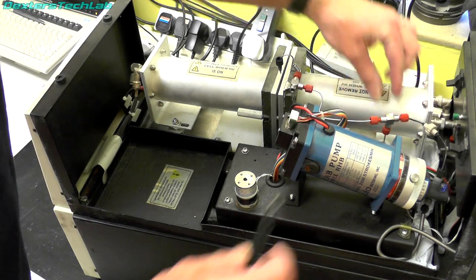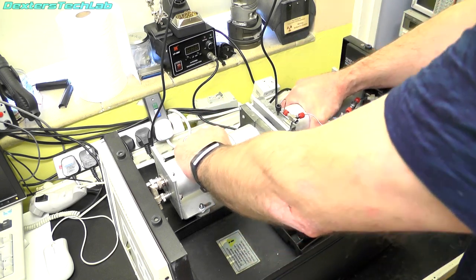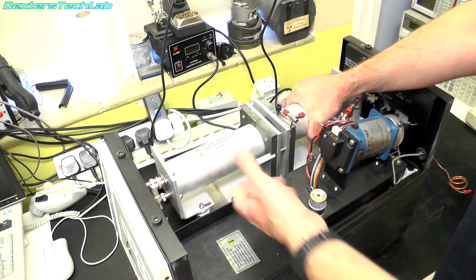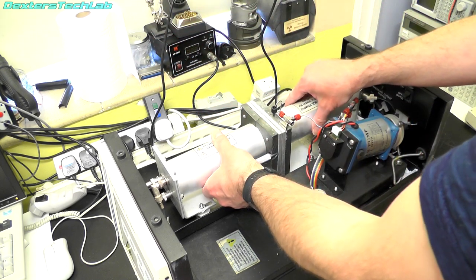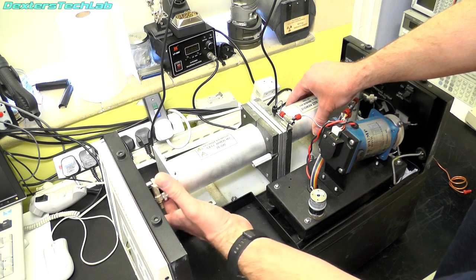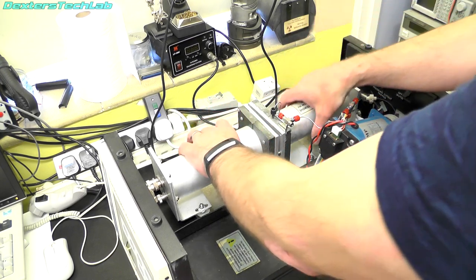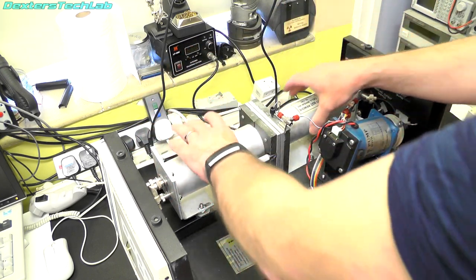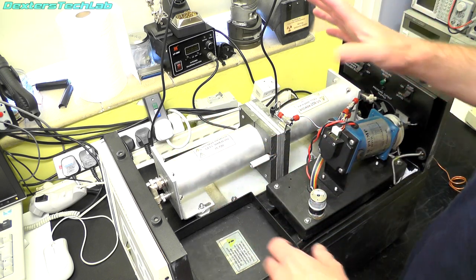For clarity, these will be two fairly large photo multipliers — used a lot in this kind of application where you need to detect very very low levels of visible or non-visible light. We've got one, two, three connections on each one, and they'll work in parallel. The reason there are two is because it helps to improve the sensitivity of the machine.